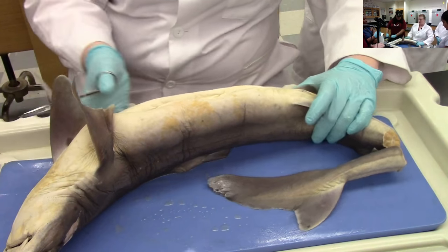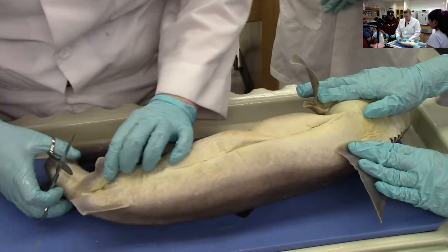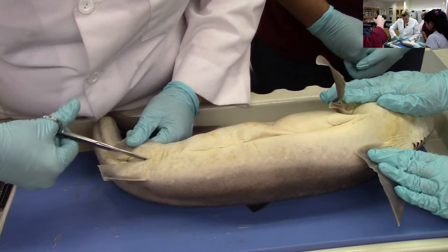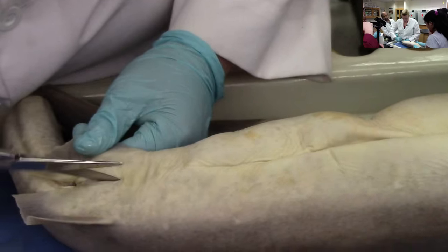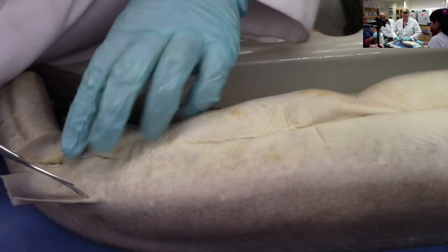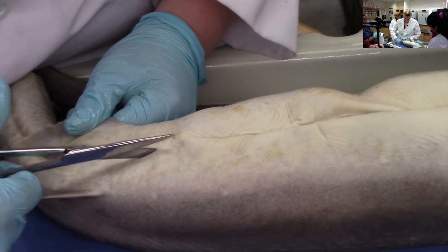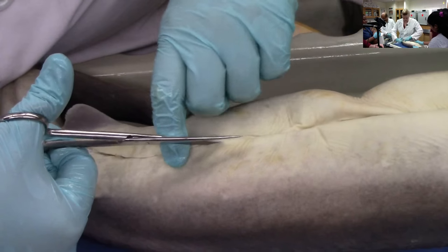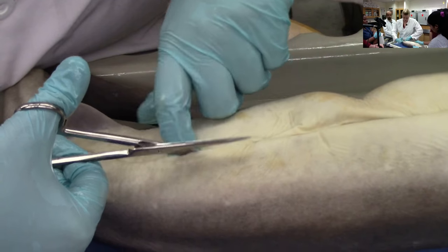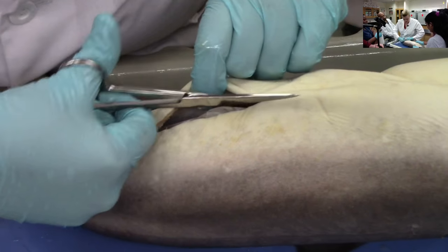So what we're going to do is cut her up the middle. I'm right-handed so I'm going to turn her. I'm going to start right here at the cloaca. Shark skin is really tough — it's kind of like sandpaper — and so getting through the shark skin with the scalpel takes a really long time, so we're just going to use some scissors. I'm not getting through because she's real big. That's the body cavity.